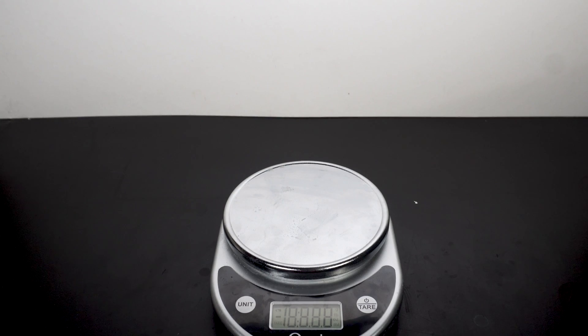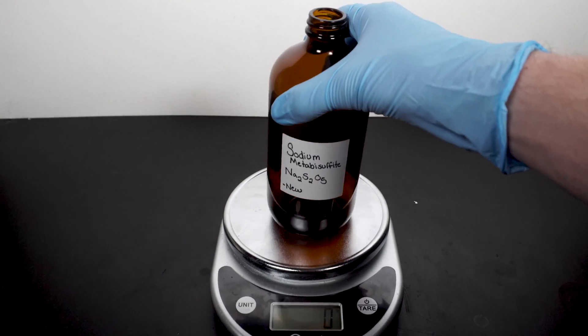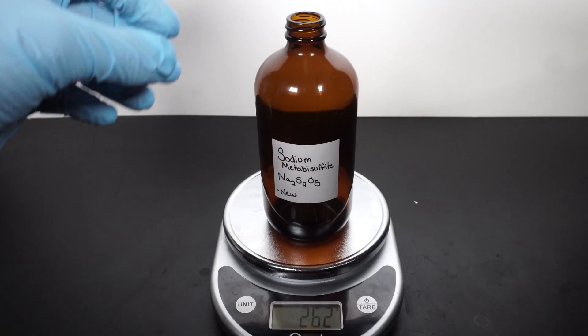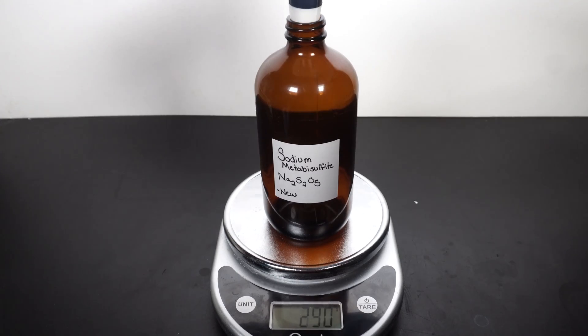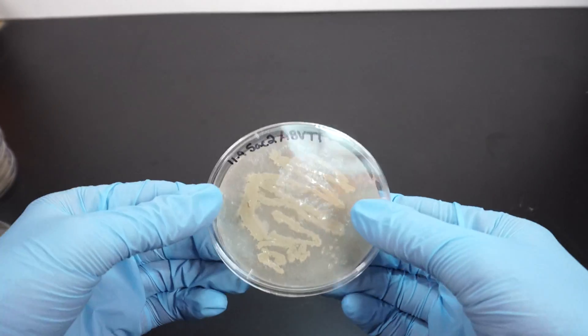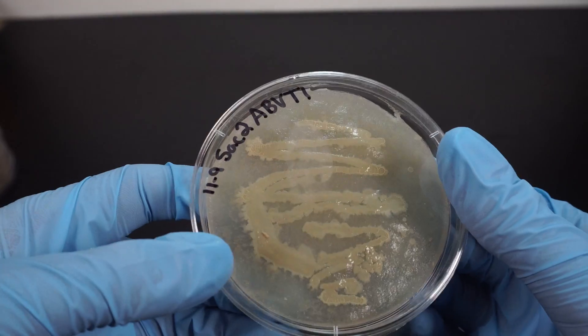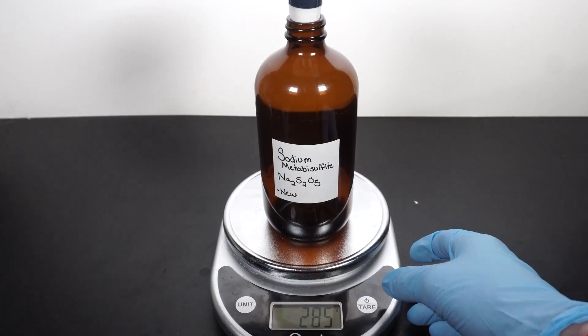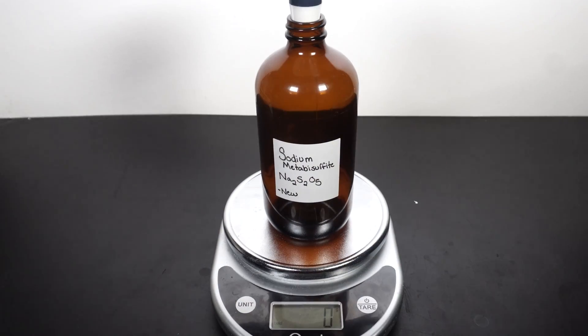In today's video I'll be making ethanol through the process of fermentation of yeast. This run will also serve as a baseline for future projects that will involve culturing and cultivation of wild yeast, which then I'll also use to make more ethanol. I figured I would start with a good control test though.